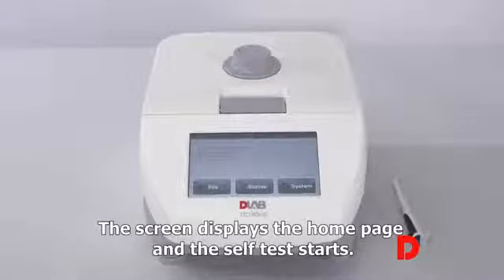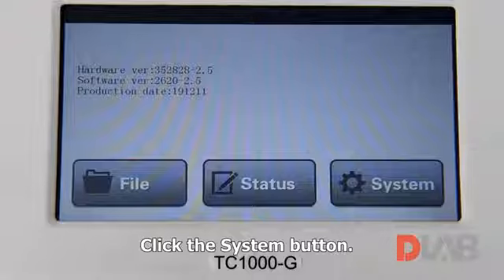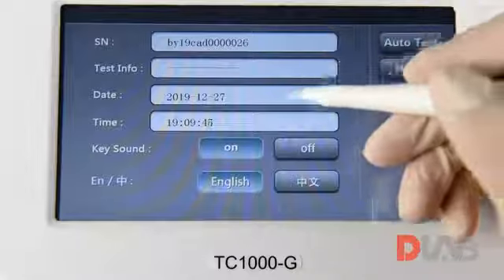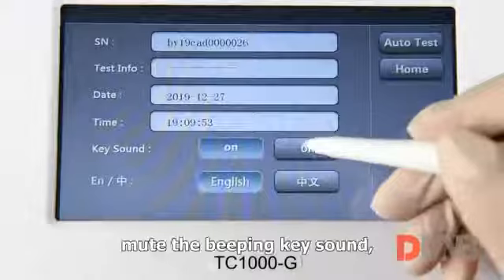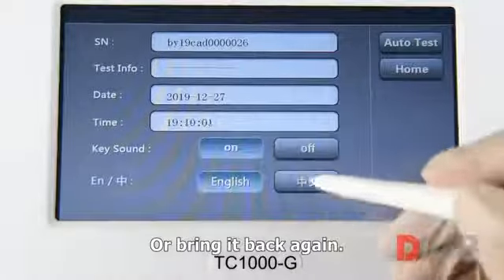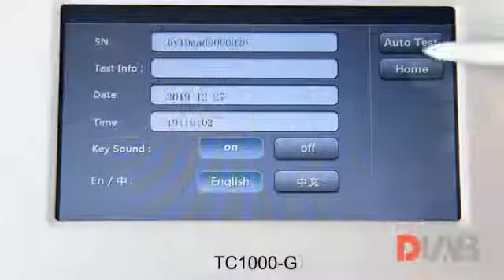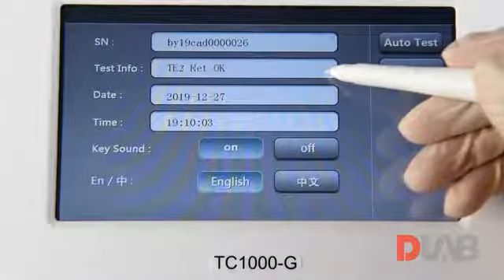The screen displays the home page and the self-test starts. System settings. Click the System button. We can see the serial number of the instrument, update the date and time settings, mute the beeping key sound, or bring it back again. Switch between English and Chinese interfaces. You can run self-test again, exactly the same as the power on.